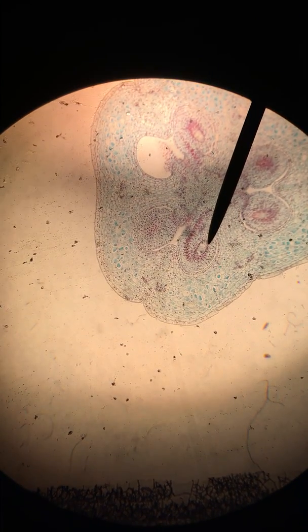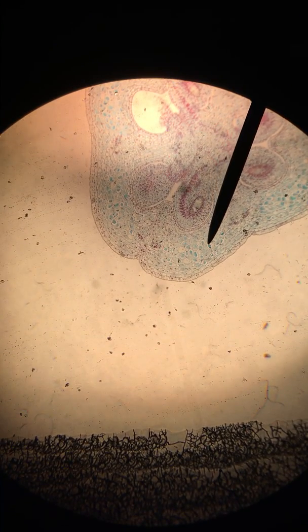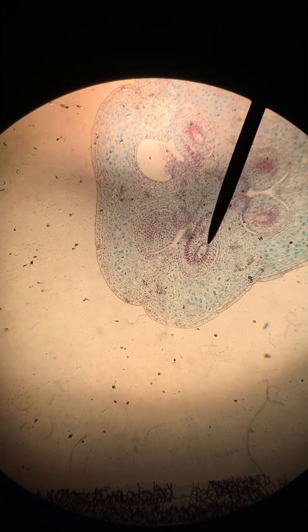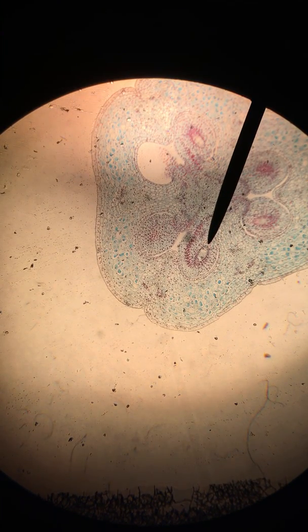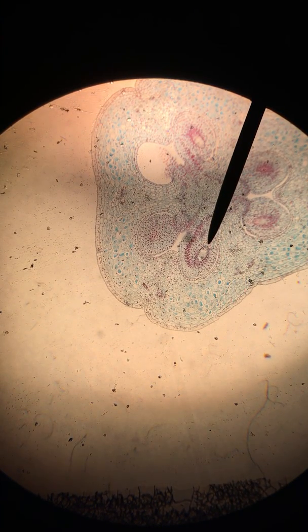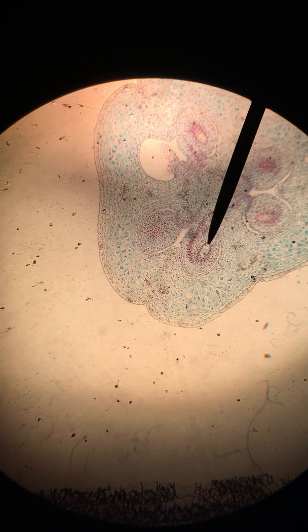Again, this is the ovule and this is the ovary wall. Inside the ovule we have our developing mega gametophyte, or embryo sac.